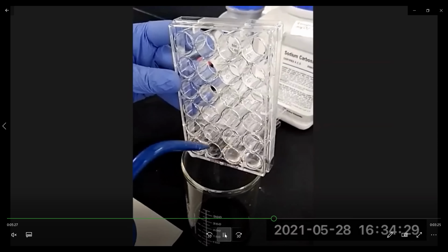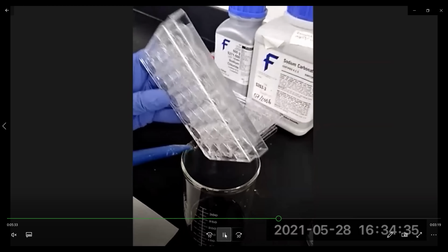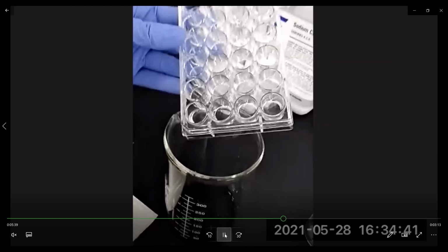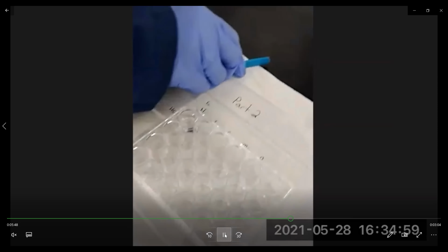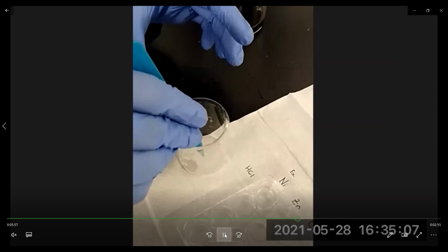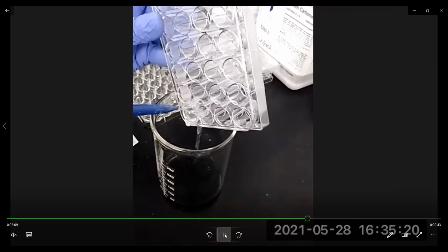So this is from part A of the chemical properties. And you can do this at your lab bench. So now it's clean. Now for part 2, which had the pieces of metal, you want to first take out the piece of metal from the cell well plate, put it in a different beaker because the solid pieces and the aqueous solution go into 2 separate waste containers. Then rinse out your cell well plate with DI water again.